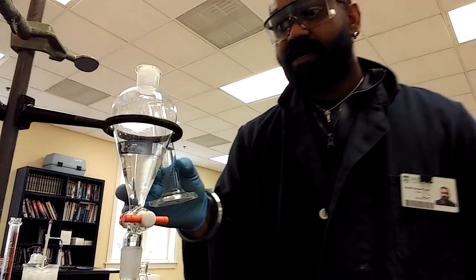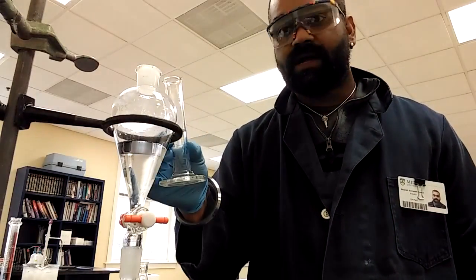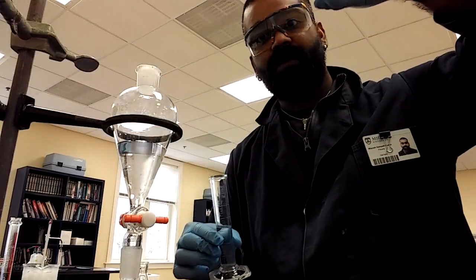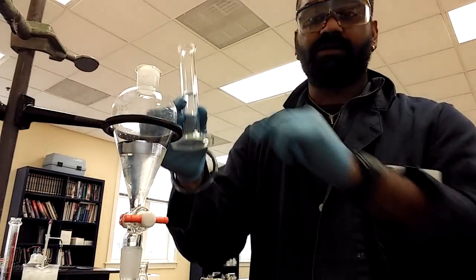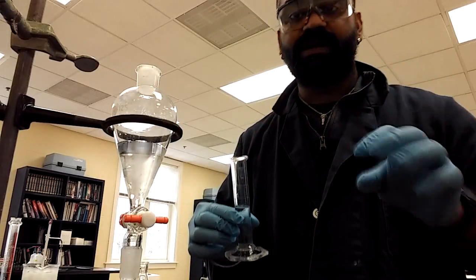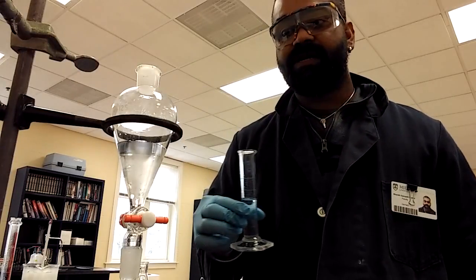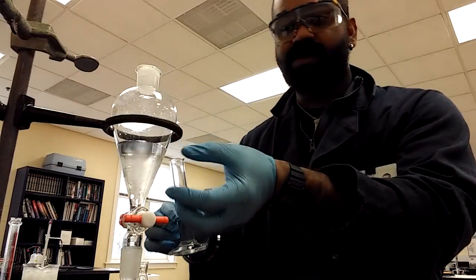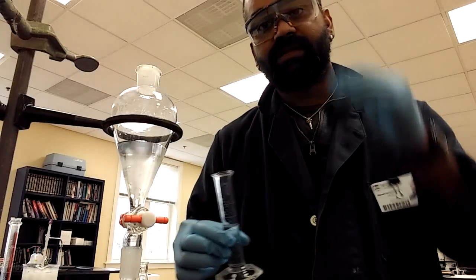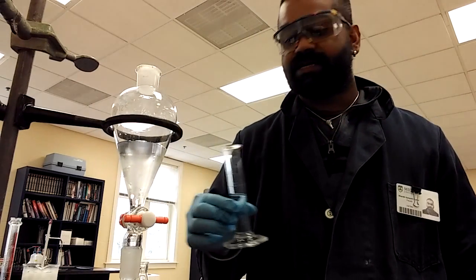And here I got my 12 milliliters of t-butyl alcohol. You don't want to add all of this in one go, okay? Add a little bit, shake, flip the stopper upside down, vent, shake until you use all of it. And then after that, we're going to shake a little bit vigorously, release the air each time, and then we're going to let it stand for like 5 minutes until the two layers separate. So basically, we have our product at the end of the procedure, but it's not pure. It's contaminated with other things. So we'll be doing the distillation, and then we'll be doing the extraction after that.